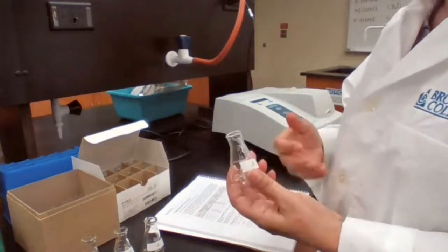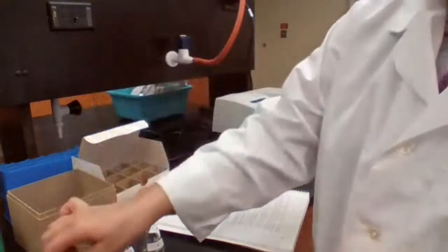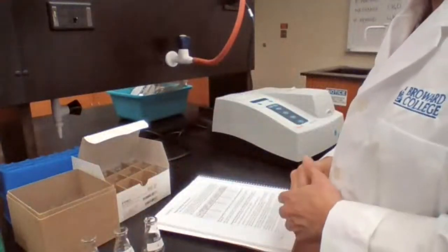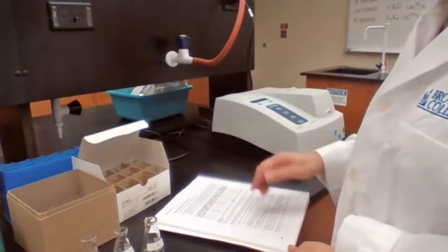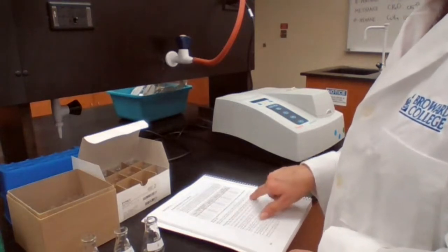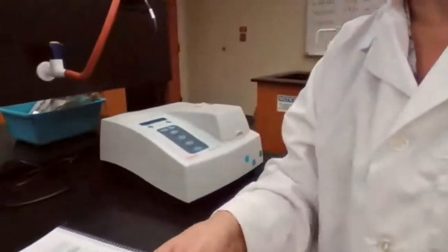Flask A is not going to have the active ingredient, basically Fe3+. Whatever measurement is taken for this will be set as zero absorption, meaning the machine needs to be calibrated to zero absorption using this blank. Then we make the other four solutions. The instrument is already on. I set up the wavelength — I'll show you, as the procedure tells you — so you know what is done and how it will be performed.